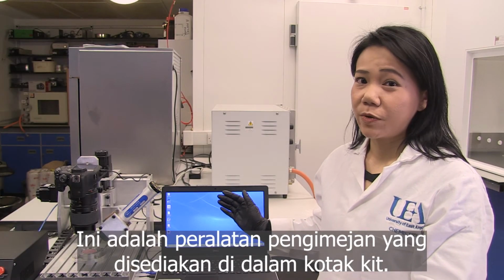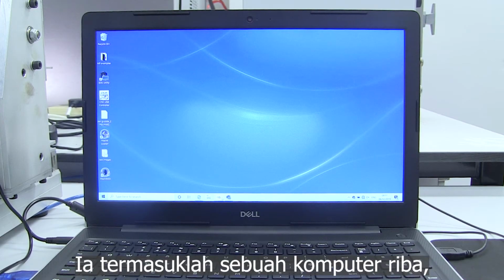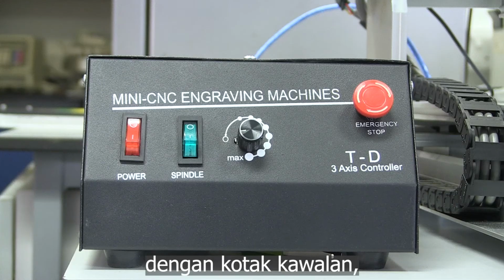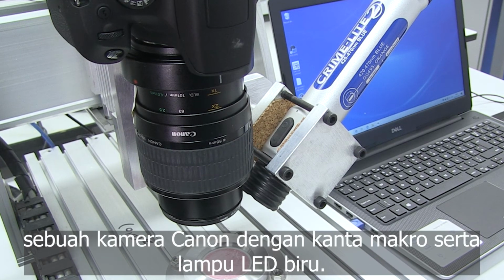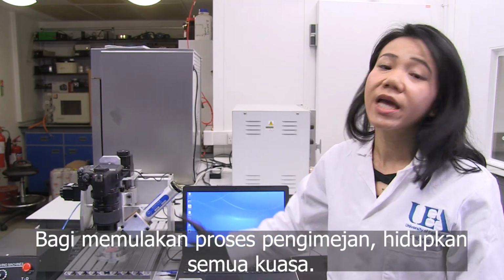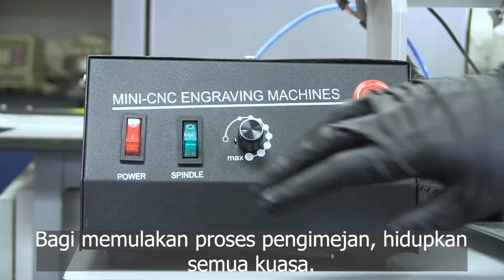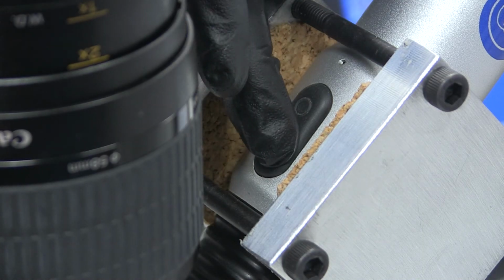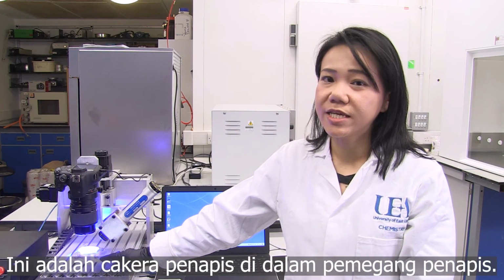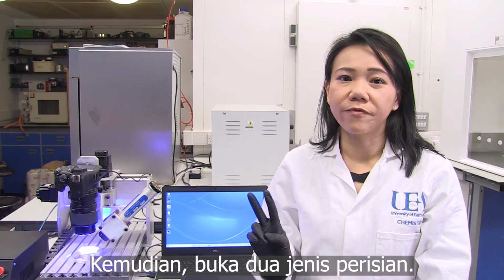This is the imaging equipment supplied in the kit box. It includes a laptop, an imaging rig with a control box, a Canon camera with a macro lens, as well as a blue LED light. In order to start the imaging process, turn on all the power. This is the filter disc in the filter holder. And then open two types of software.